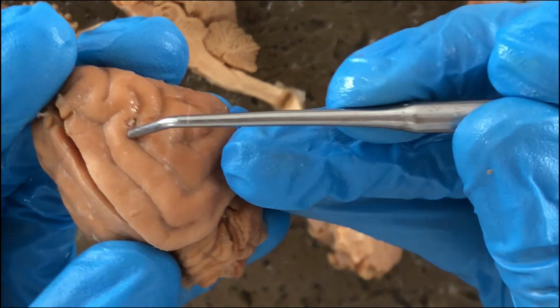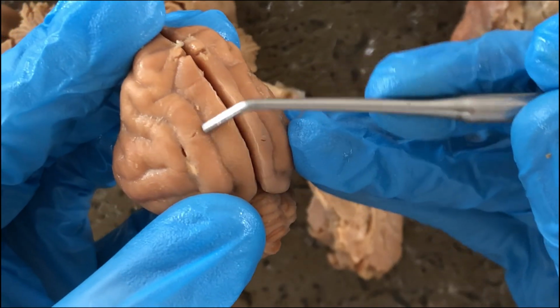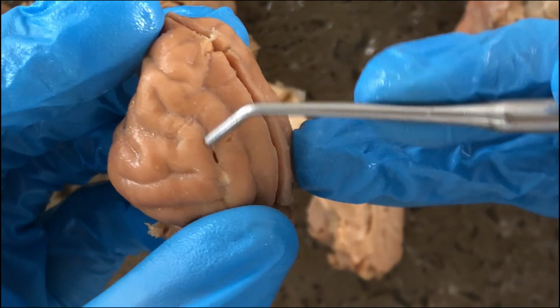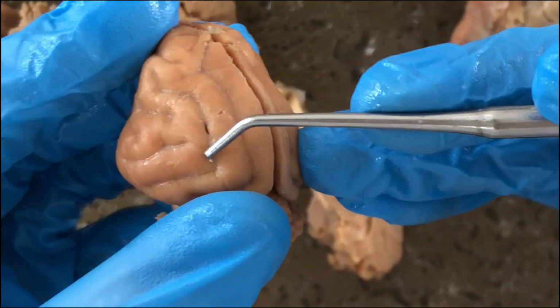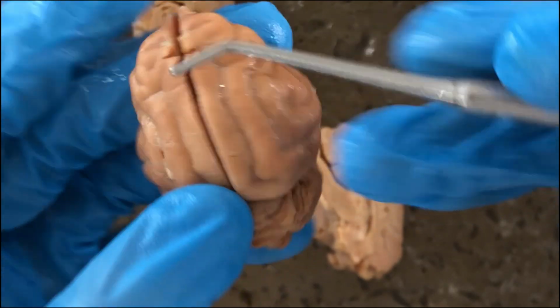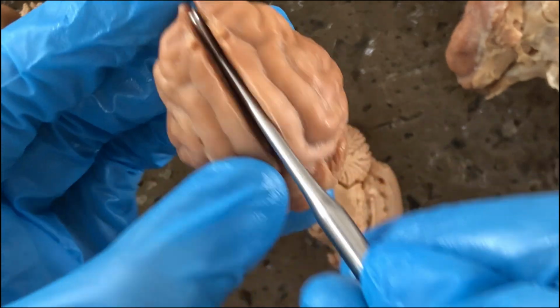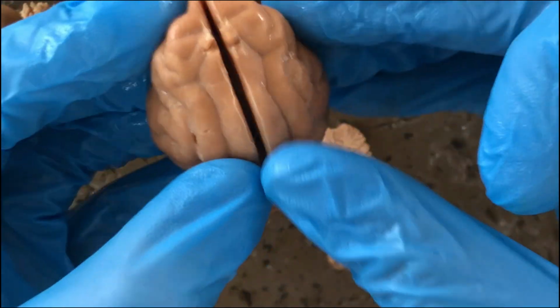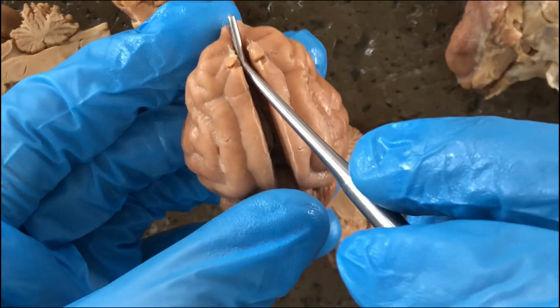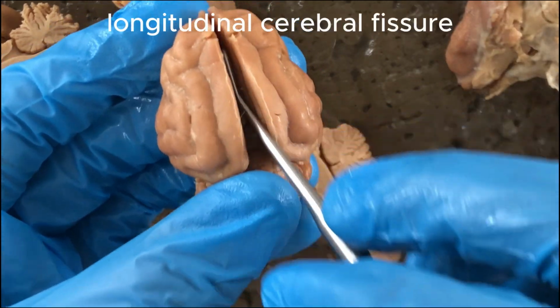And those convolutions are called gyri, or singular gyrus. And those shallow grooves in between the gyri are called sulci, singular sulcus. And this deep groove separating the left and right cerebral hemispheres would be the longitudinal cerebral fissure.